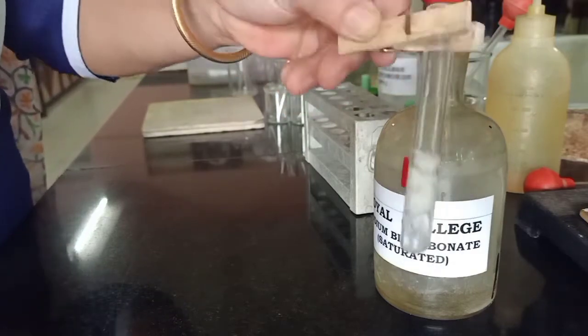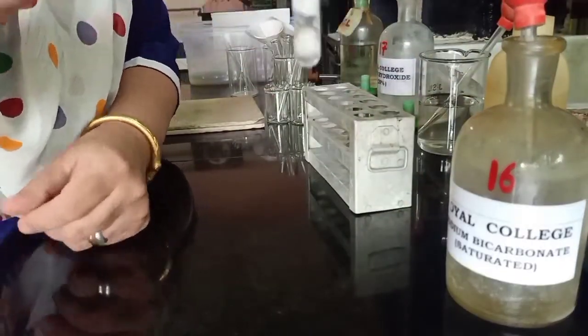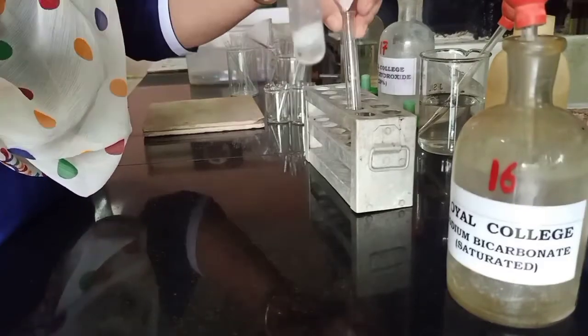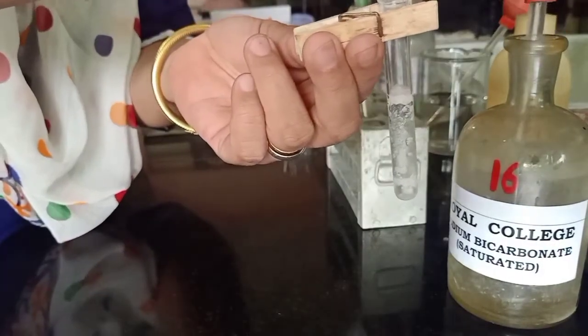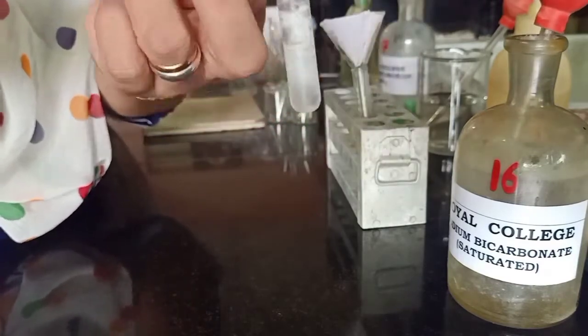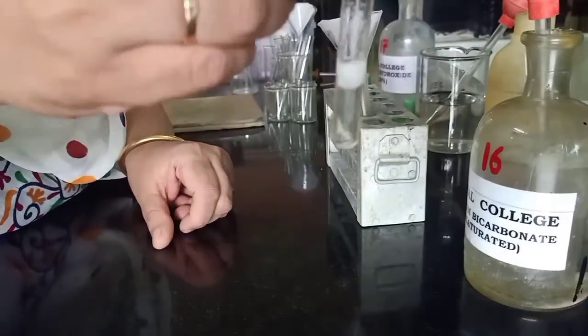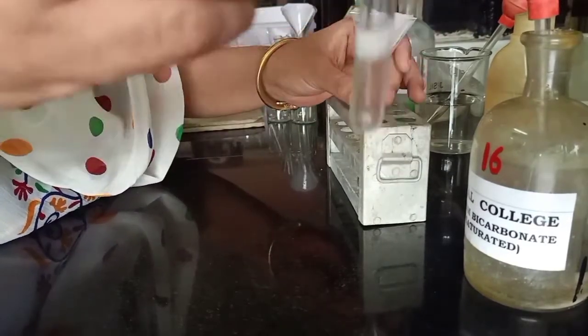We will shake this very thoroughly and check for re-precipitation. We add a little more bicarbonate to ensure that all the acid is dissolved, because we need to ensure that both components are separated completely. All the acid has been dissolved by addition of the bicarbonate and there is no more effervescence taking place. So we will filter this now.